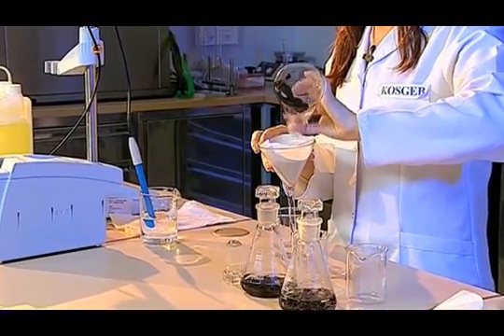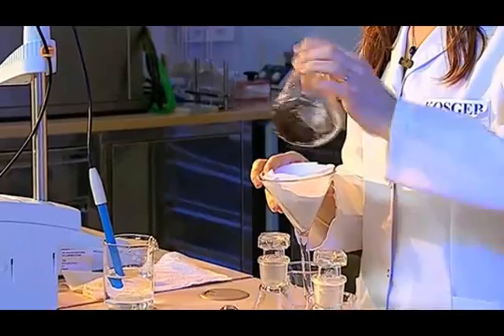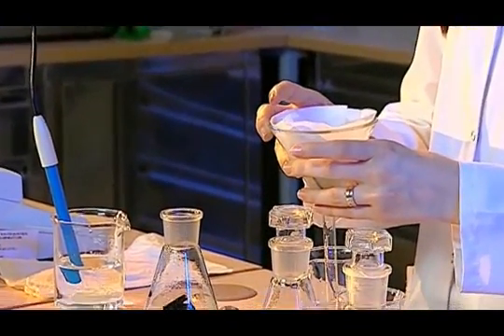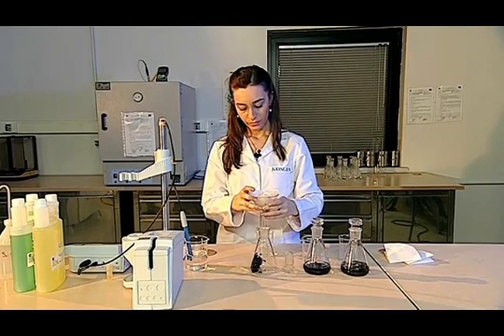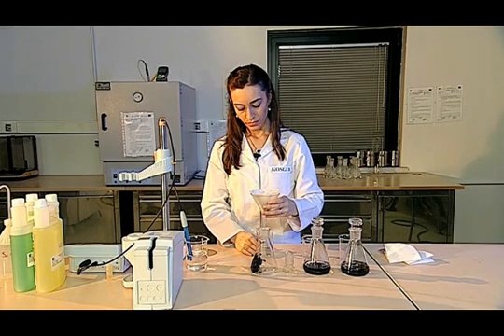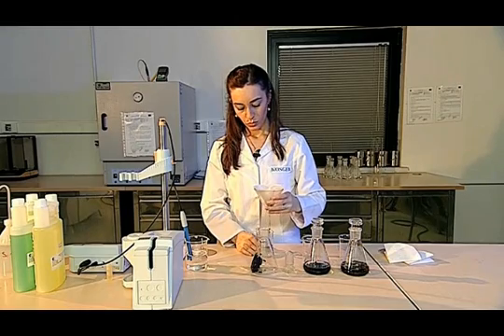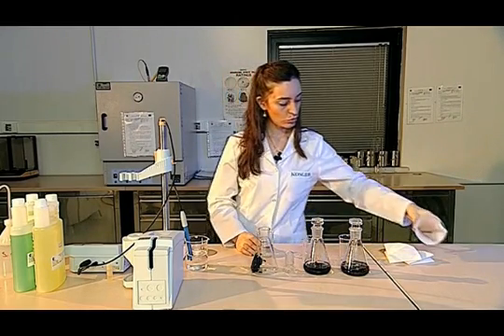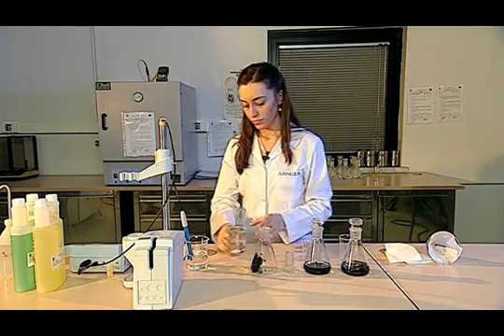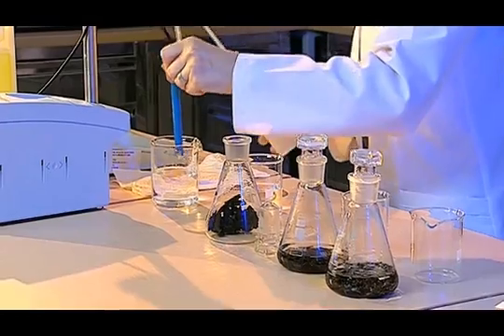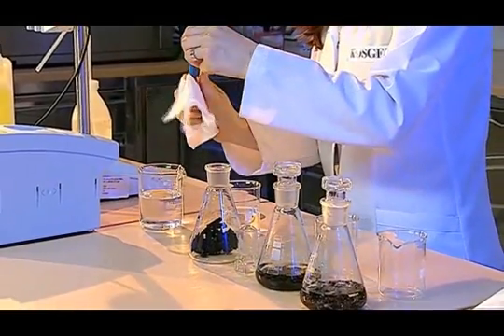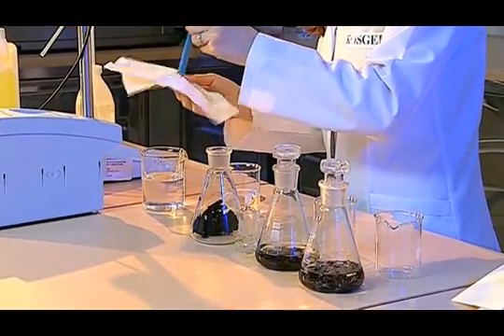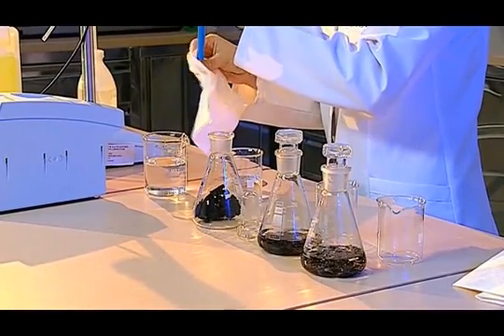We wore gloves in the process of the sample preparation, but we don't have to wear gloves here, because we do not touch the solution with our hands. After filtering the sample properly, I immediately wash the tip of the electrode with pure water. I dry it sensitively, so that there is no wetness anywhere, and dip it into the solution.